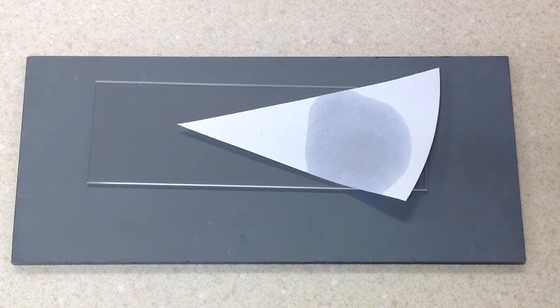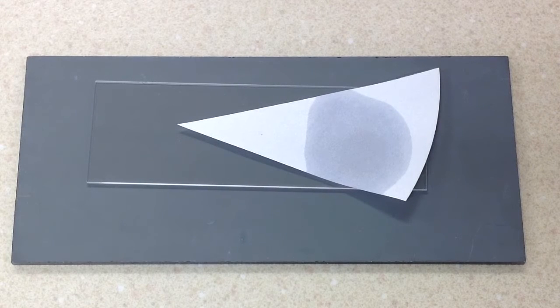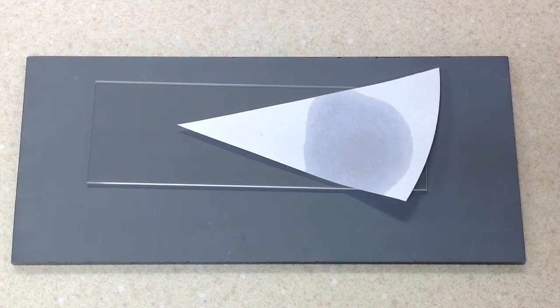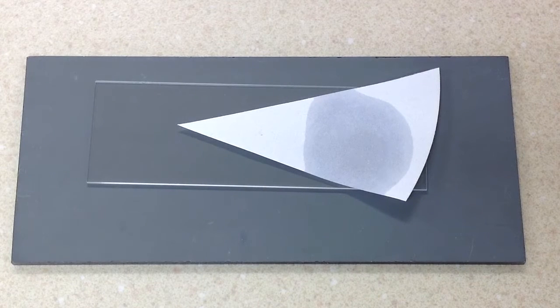Now, the manufacturer recommends that these colonies be around 18 to 24 hours old, and that you're not taking them off selective differential plates.